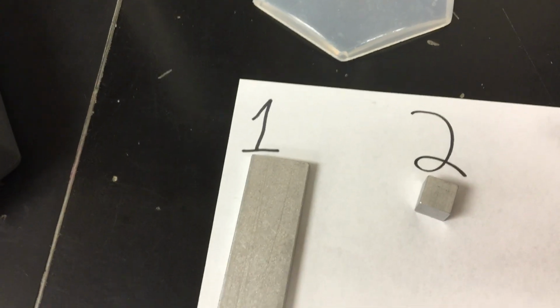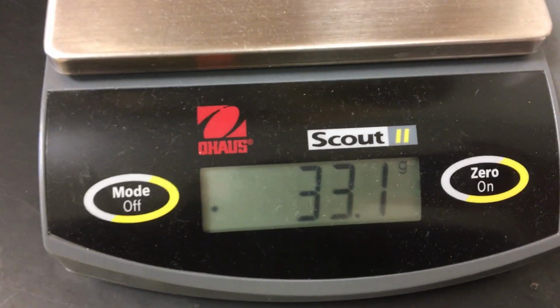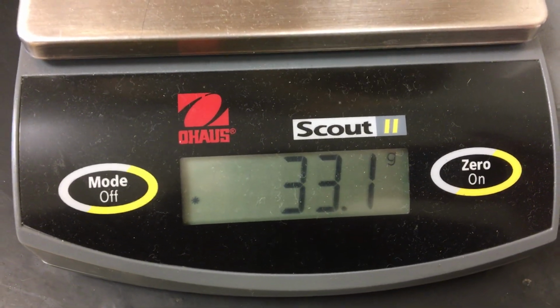We want to do this. Maybe 0.6. All right, so those should go in your lab, and again, rewind it if you get stuck in any of those. So that's length, width, and height. How do you get the volume? And then how about the mass? There you go. Oh, what's it going to be? There's your mass for object number one.